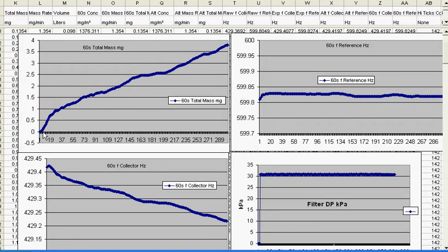But what we have here is, as the filter was started, the frequency goes down. Remember, as a resonant structure resonates, it gets heavier on the end. Picture an elephant on the end of a resonator. It's going to go slow, and a light Tweety bird on the end will resonate quickly. So what we have is the resonant frequency with this little bump here shows that the filter seating slowly decreases monotonically and gives an indication of the total mass.